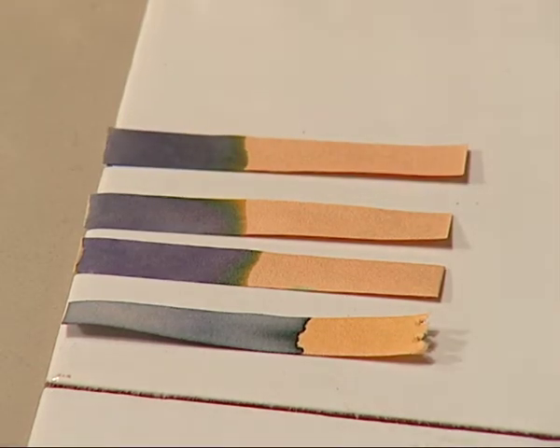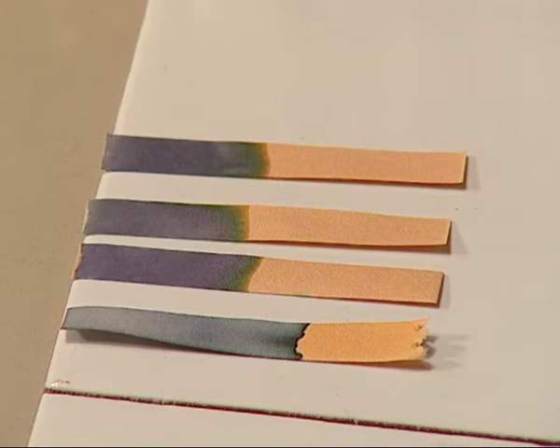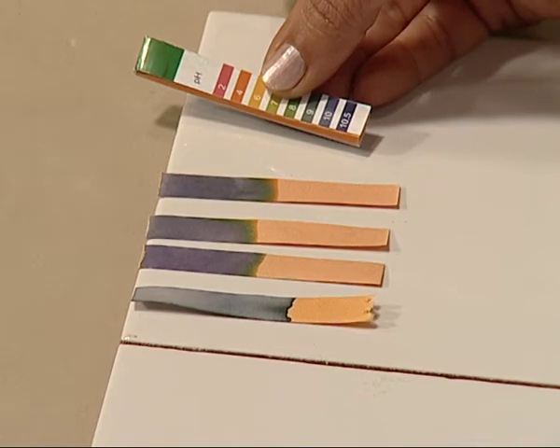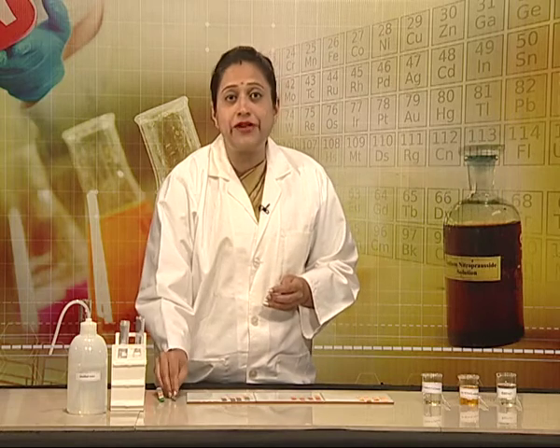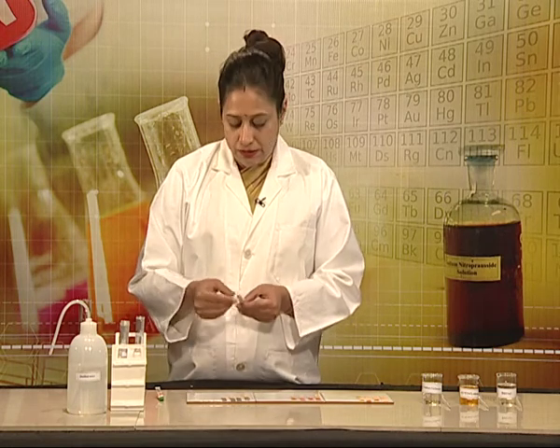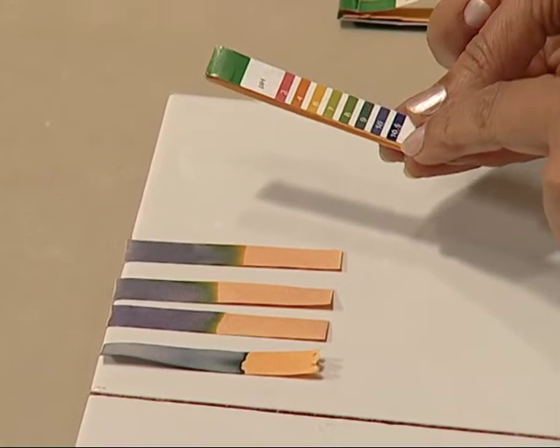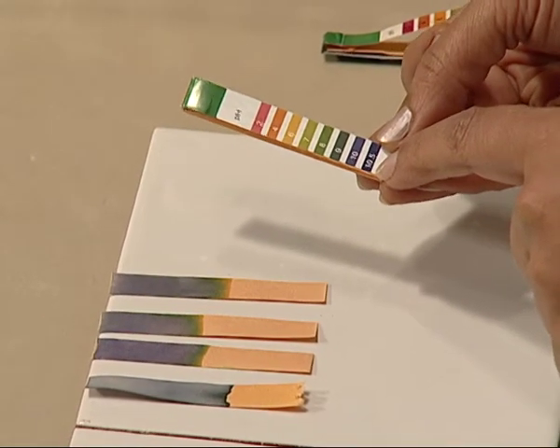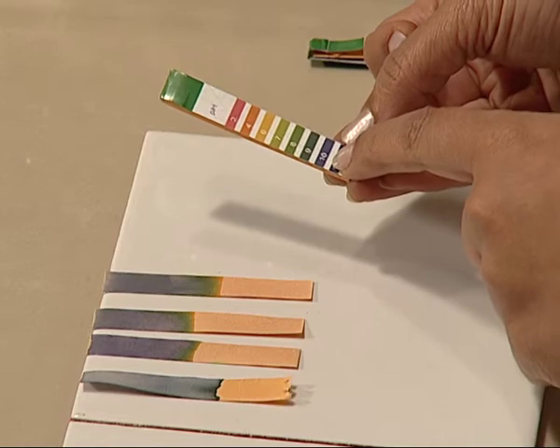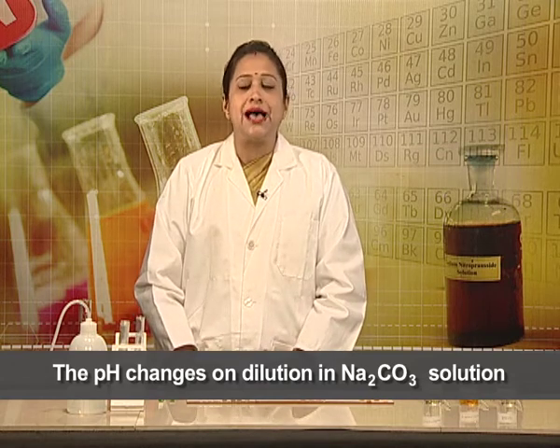The colour developed shows a slight change in this case. When we match it on the pH strip, the pH has changed from 10.5 and moved to a pH of 9.5 to 10. So the effect of dilution can be seen in the case of sodium carbonate solution also. Our basic stock solution of 0.1 molar sodium carbonate had a pH of about 10.5, and gradually on dilution we have reached a value of 9.5 to 10.